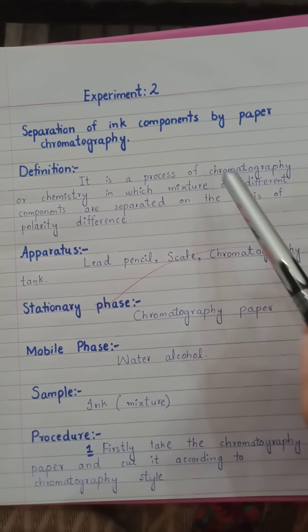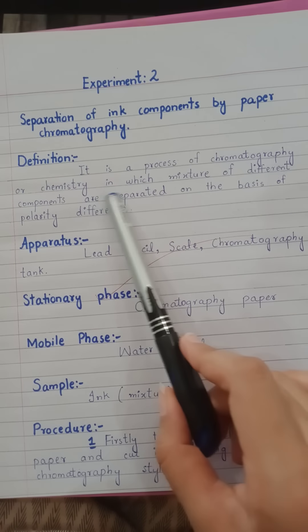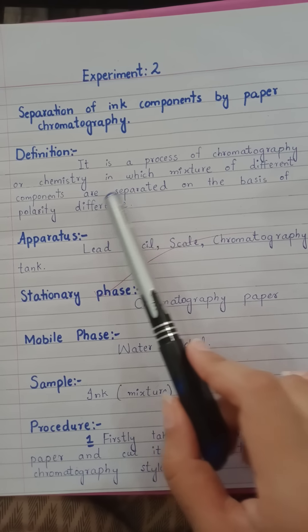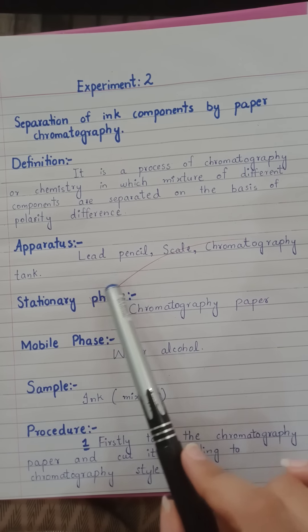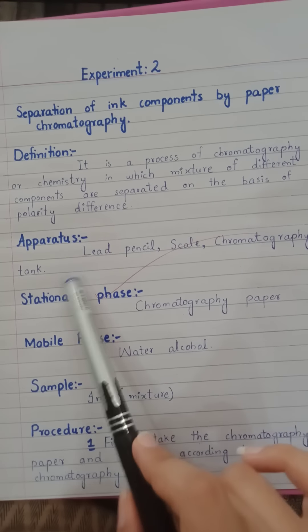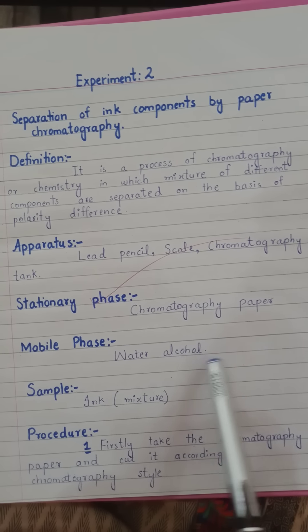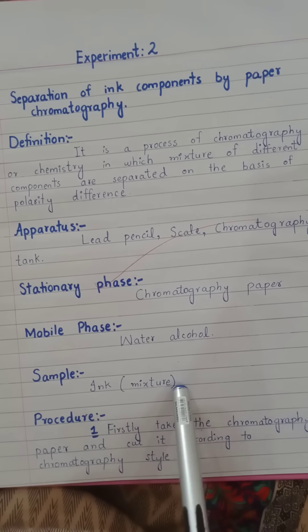Now we will discuss about the separation of ink components by paper chromatography. It is a process of chromatography in which a mixture of different components are separated on the basis of polarity difference. The apparatus consists of a lead pencil, scale, and chromatography tank. The stationary phase includes chromatography paper, and the mobile phase includes water and alcohol. The sample consists of ink or a mixture.